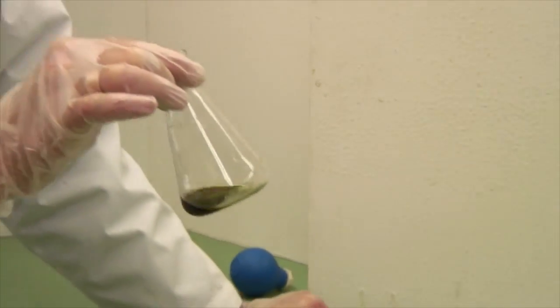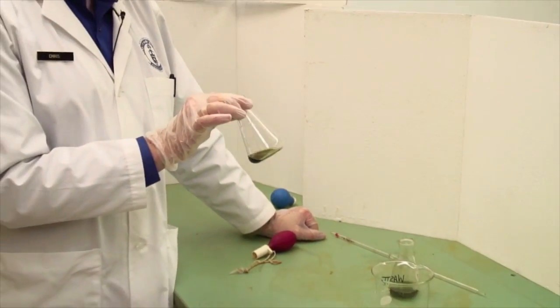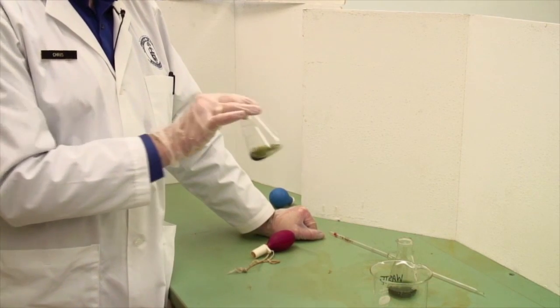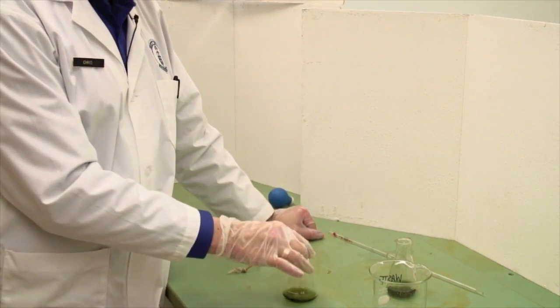In the technique that I've just used, I have now dispensed 10.00 milliliters. That's exactly 10 milliliters of—it's actually bromocresol green liquid—into this flask.